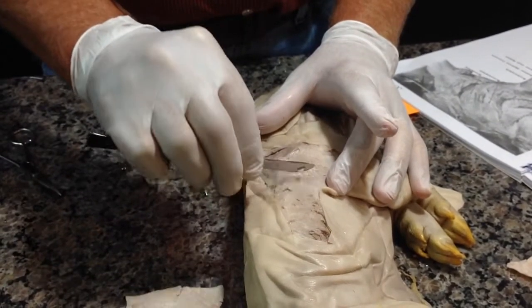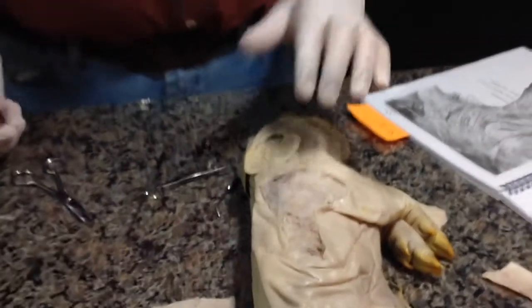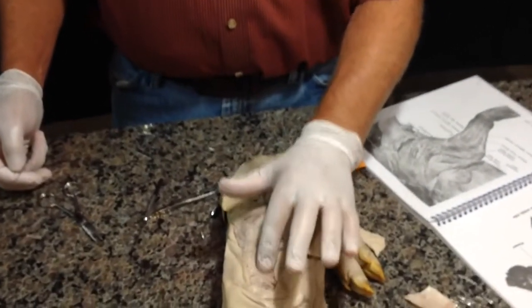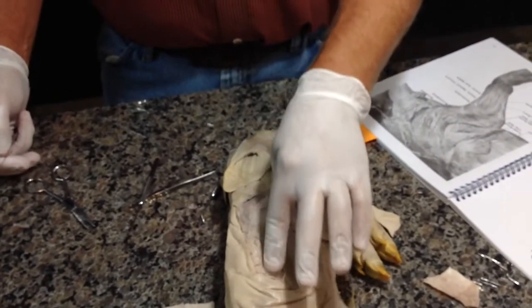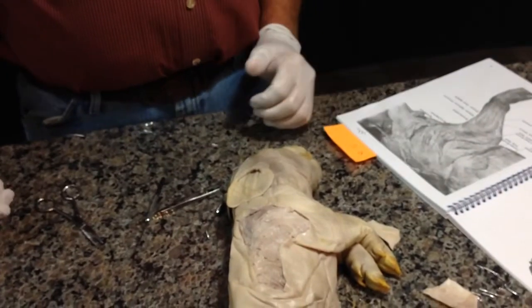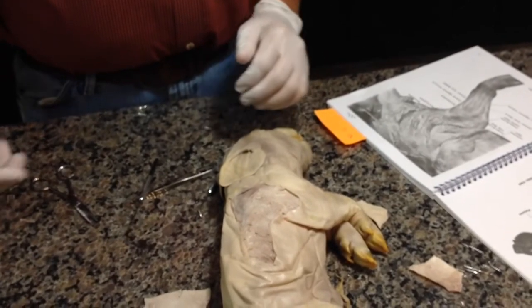Now let me ask you this: why is this pig so lean? Ordinarily we would have a little more fat even under that skin, and here I can feel the ribs and the latissimus dorsi muscles across those ribs. But why is this? You suppose this pig just hasn't had a chance to eat a lot of grain? And you're right. As a matter of fact, what is this?